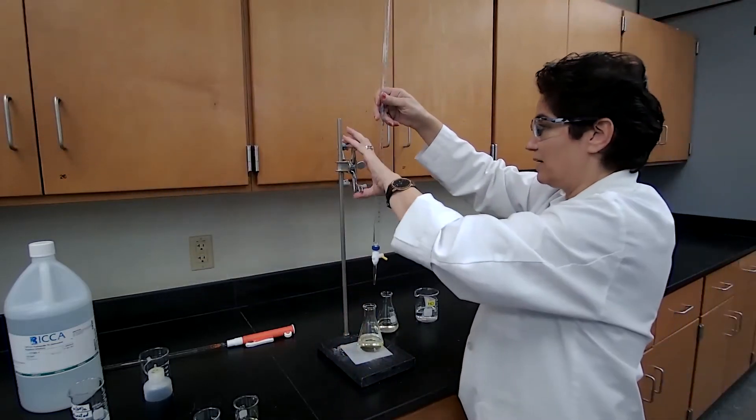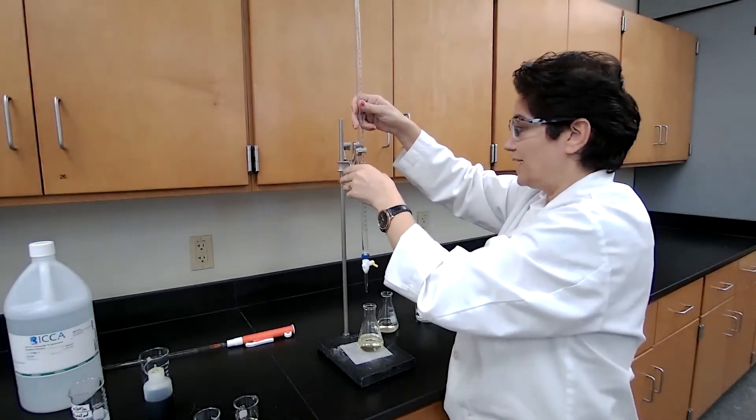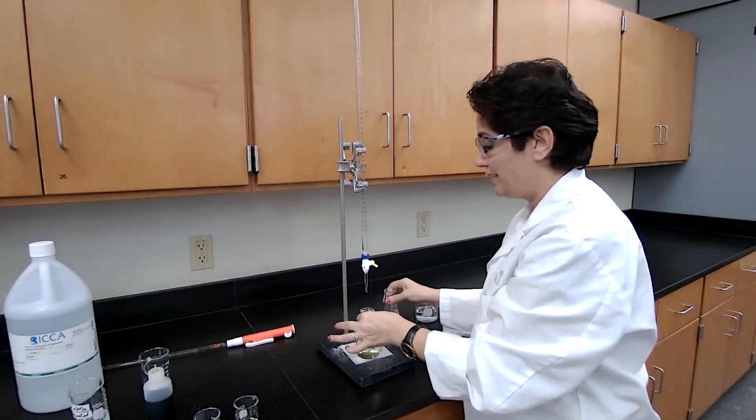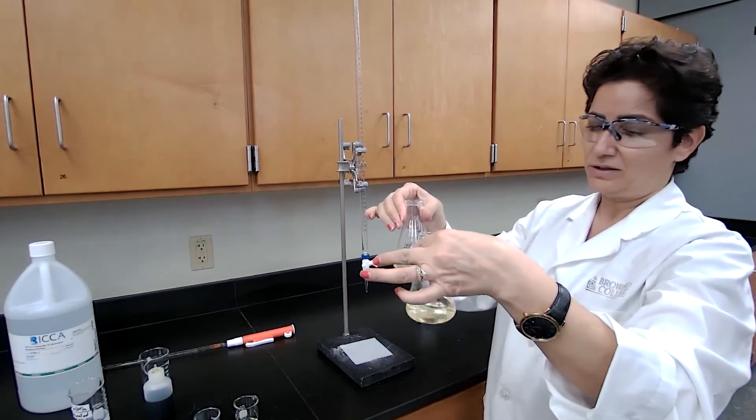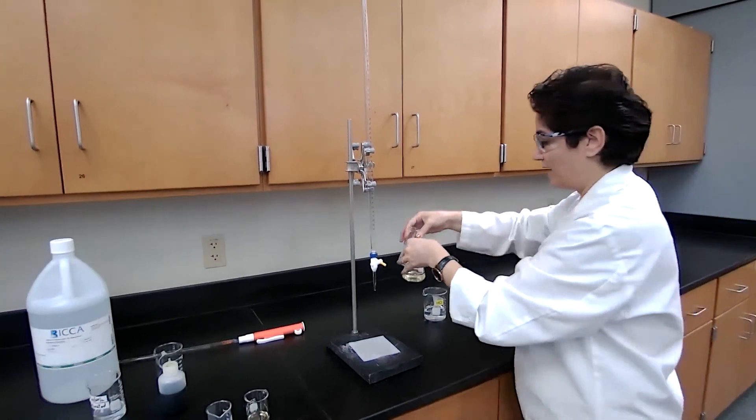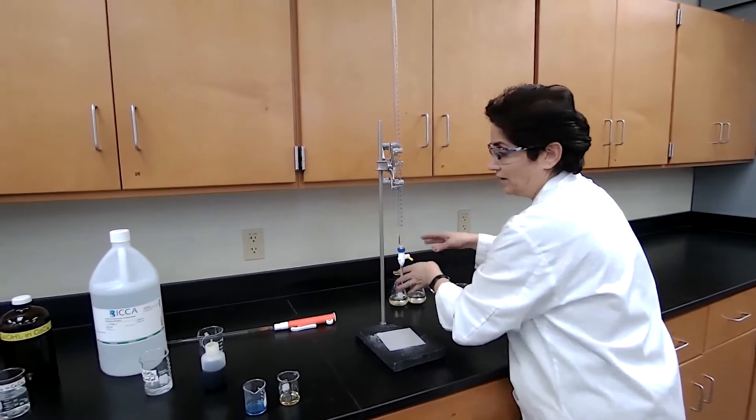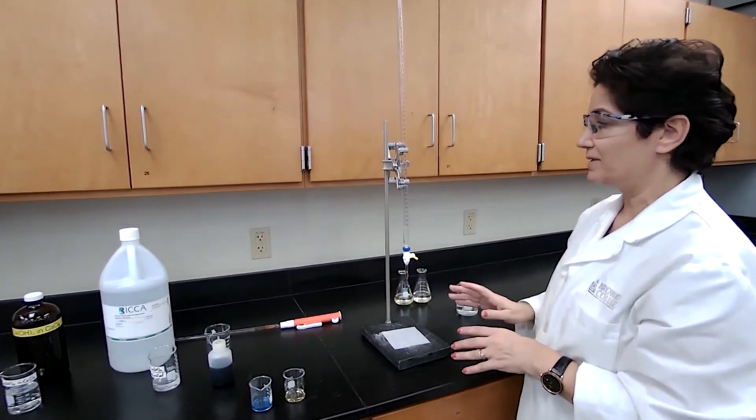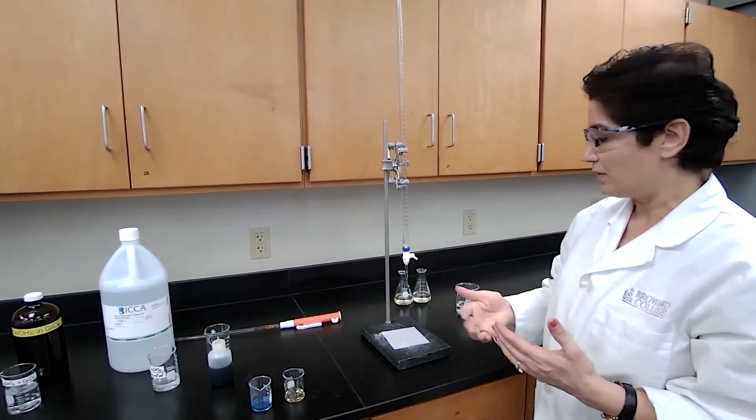Since the two numbers are close to one another, I don't have to repeat the third trial. If they were far from each other, I would have to repeat the third trial. But I have the two trials for this experiment. We are done with the part one of the experiment. I'm getting ready for the second part of the experiment.